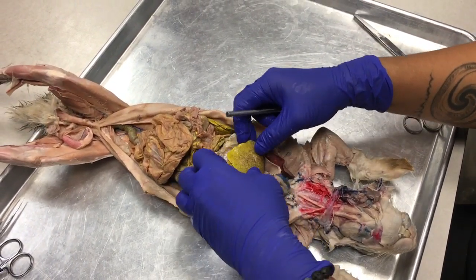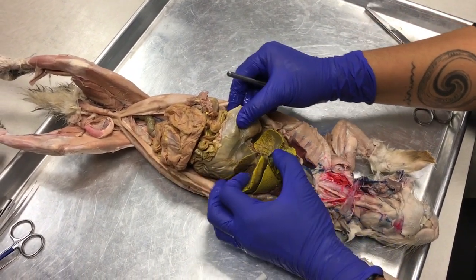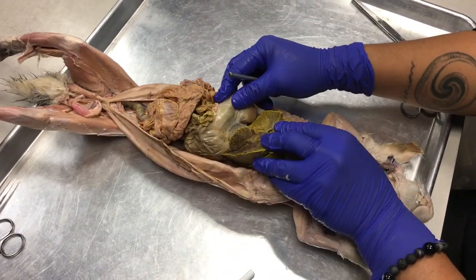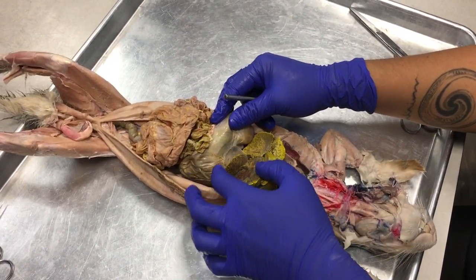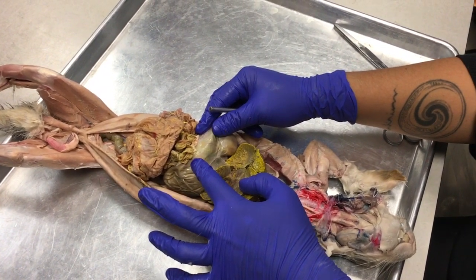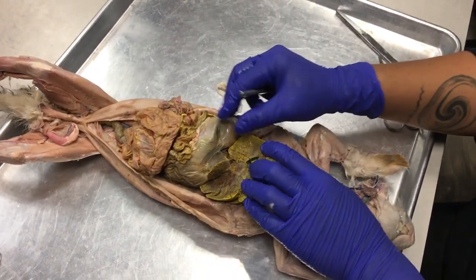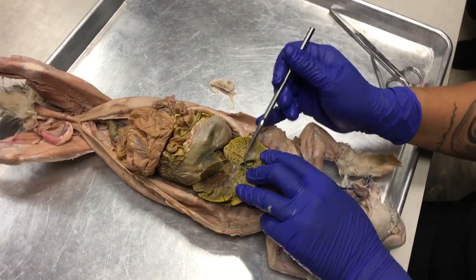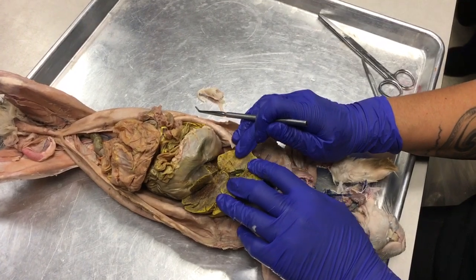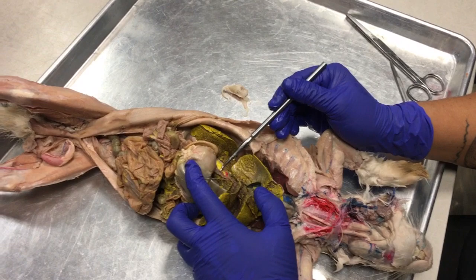Okay. If I lift up on the bulk of the liver, I reveal the stomach, and I reveal another mesentery that has a little accessory lobe of the liver sitting in it. That mesentery is extending from the liver to the stomach. It's called the gastrohepatic ligament. If I look up on the liver here, I see a stinky green balloon. Gallbladder. Okay, good.